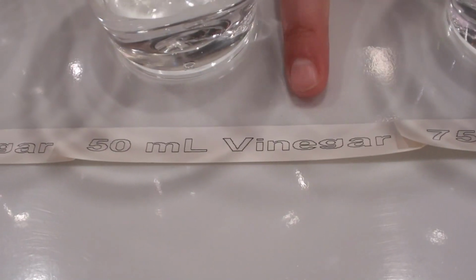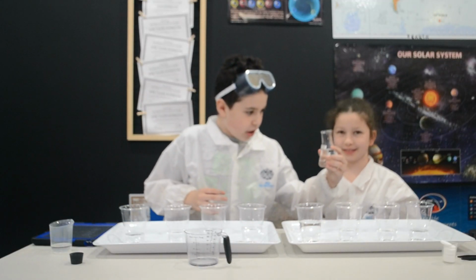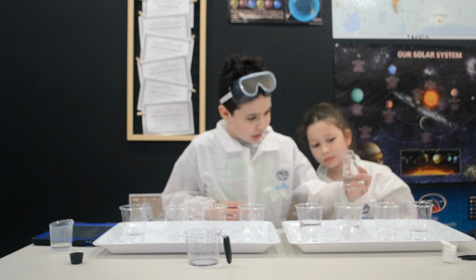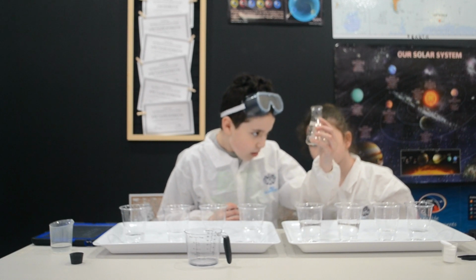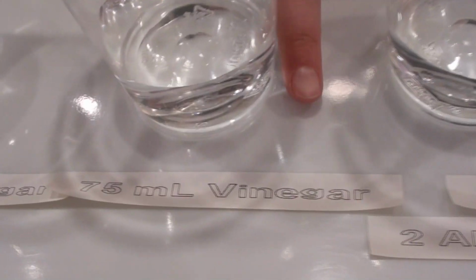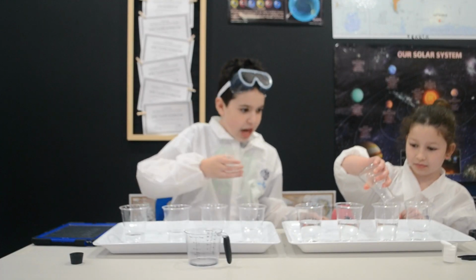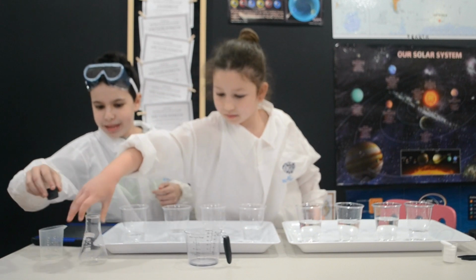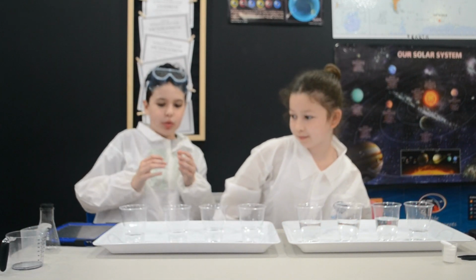Now we're going to go to this 50 milliliter one. No, we're not going to pour the whole thing. So we have 100 here. We're going to pour this until we have about 50. So that's about just over 25. That's 25. Now I have 50. And now we're going to pour in all the rest in here. Now we're going to close away the flasks and move them over here since we no longer need them.